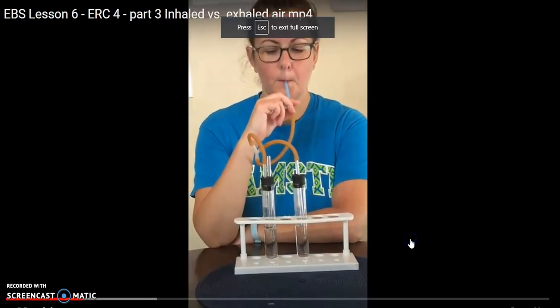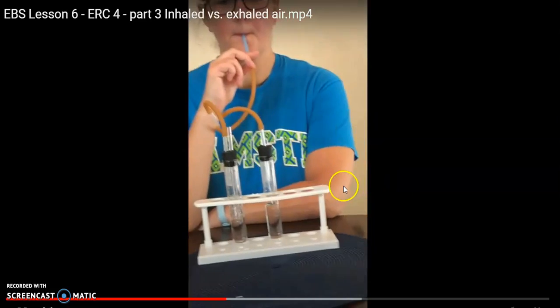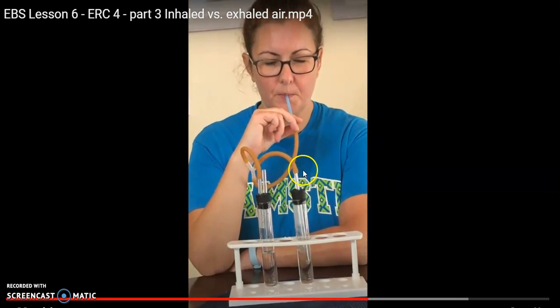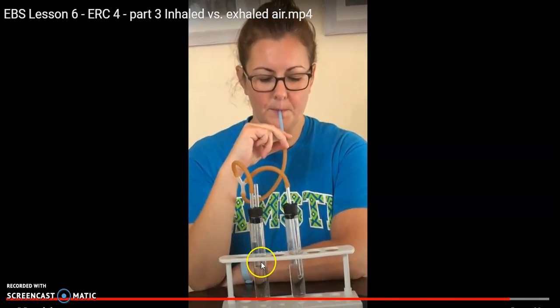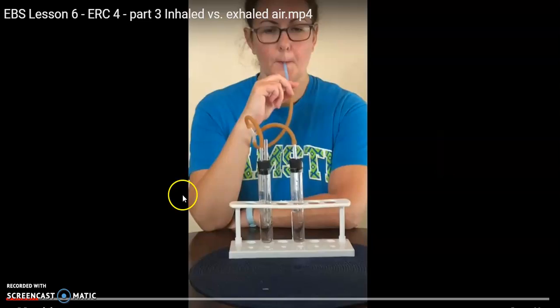Here you see one of my teacher friends. She is helping out with this investigation. We're using a breathing apparatus. When she breathes in, she's taking up air from this side. I'll show that to you again. When she's exhaling air, you'll notice she's pushing air out. It's going through this side. And when she's breathing air in, it's coming from this side. So let's take a closer look at that.